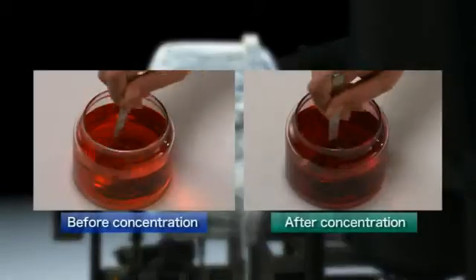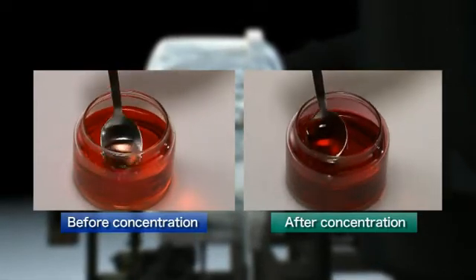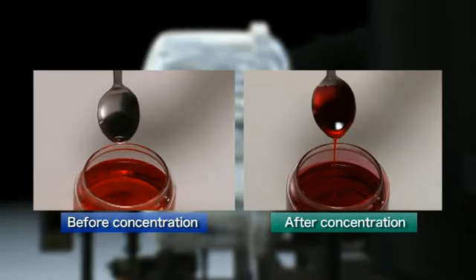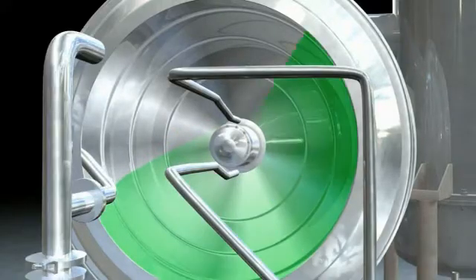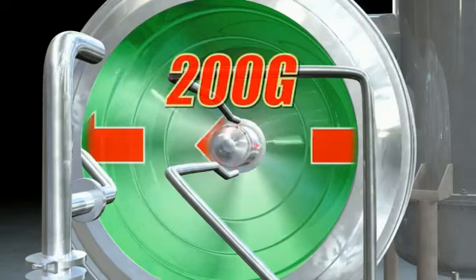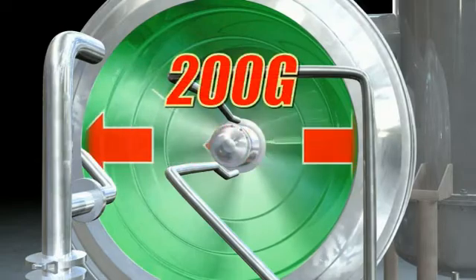Because the heat transfer coefficient is so exceptionally high, the Evapor can concentrate the product to a high density, as seen here. Spinning at high speed, the rotor generates over 200 Gs of centrifugal force, enabling processing of even highly viscous and foaming liquids.